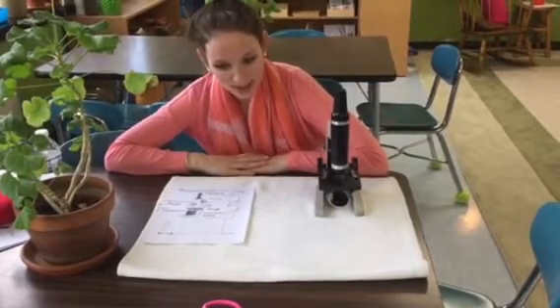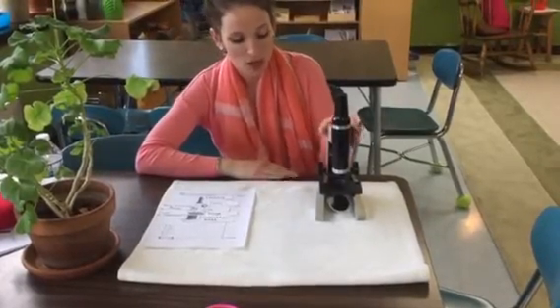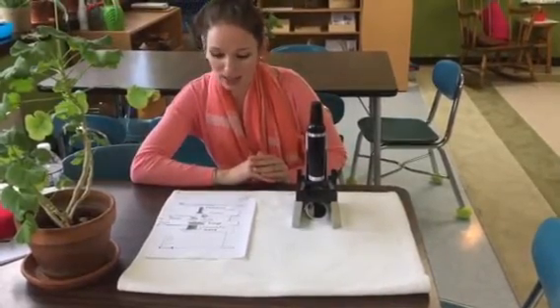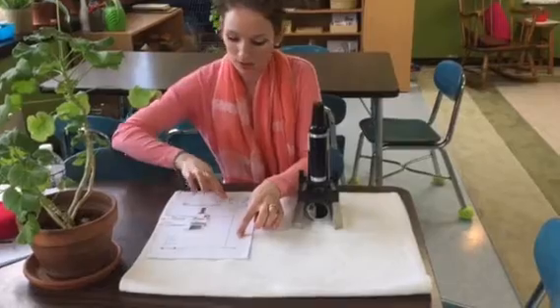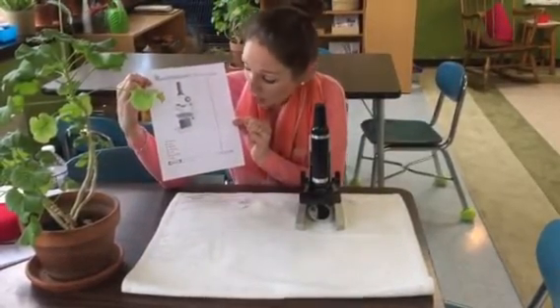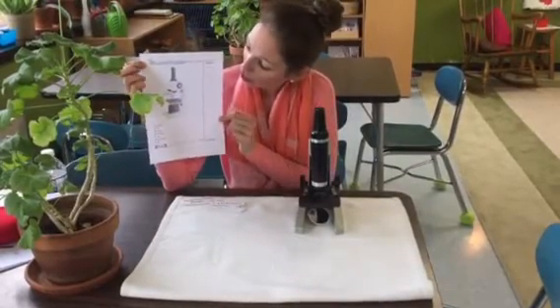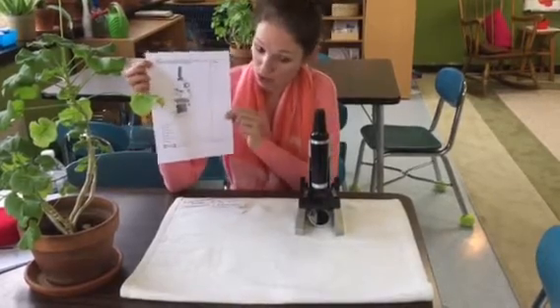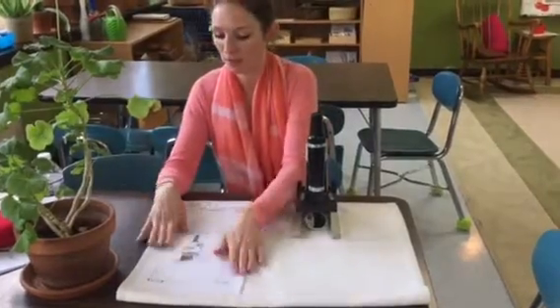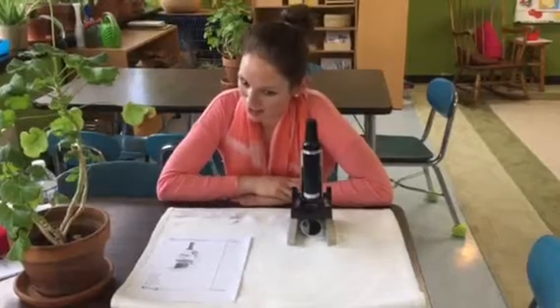Oh, good, you liked this lesson? You're excited to use the microscope? I'm excited for you to use the microscope also. Before we examine our first slide, just to do a little follow-up to this lesson, would you mind labeling this one yourself? It has all of our parts listed right here. You just have to identify and record which numbers or which letters correspond to those parts. Would you like to do that? Oh, that's so great. I thought that you would. So let me know when you're finished that, and we'll move on to finding some slides and specimens.